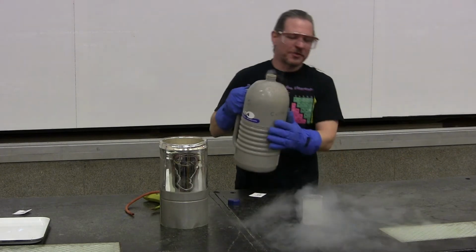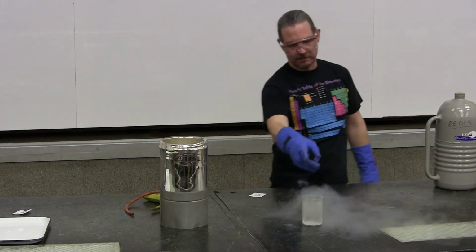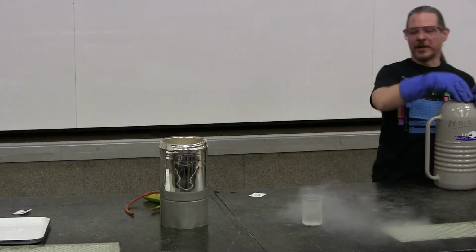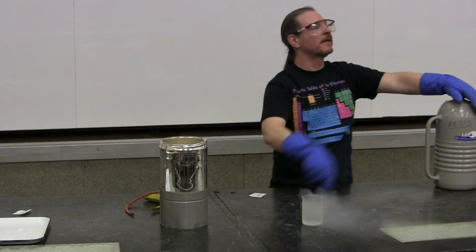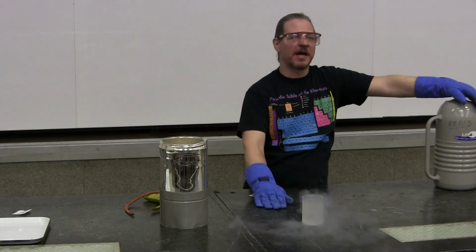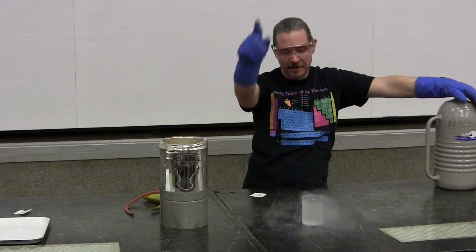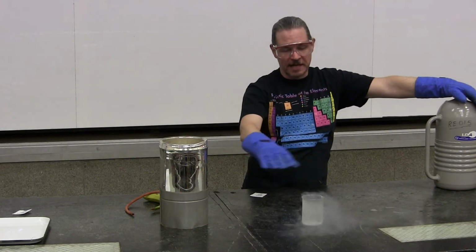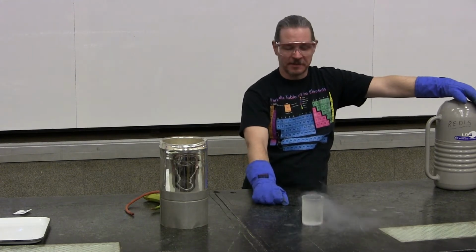And what is that liquid nitrogen doing? Okay, it's definitely smoking. What else is it doing? What do you see? Somebody said it, boiling. Okay, this room is piping hot compared to the liquid nitrogen, and it boils at negative 196 Celsius. And since temperature remains constant during phase change, I'm pretty confident we're at negative 196 degrees Celsius.